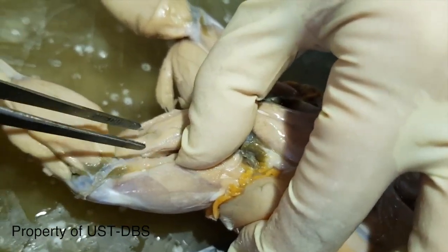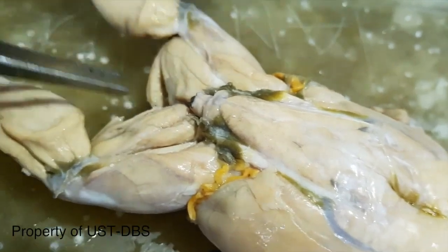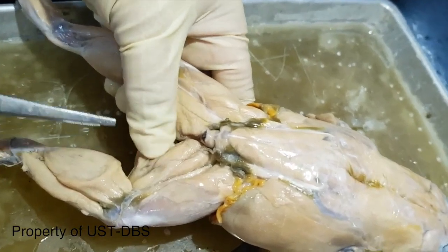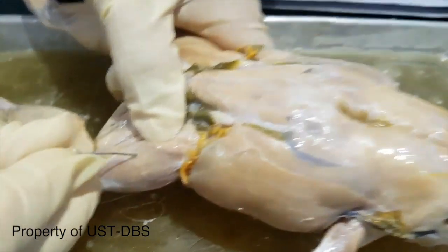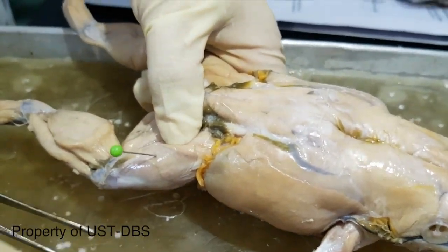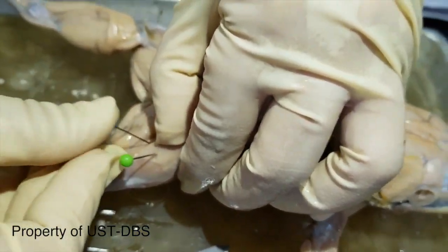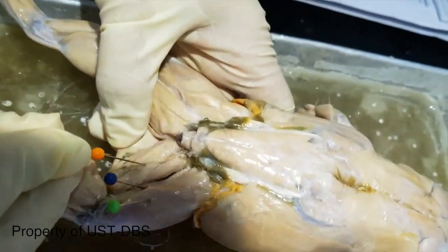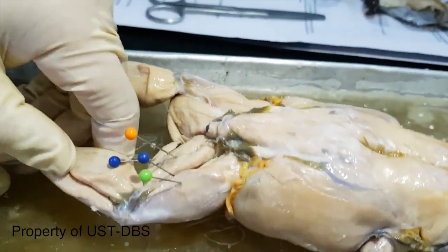This muscle here towards the inner thigh is the semimembranosus, and this flap of muscle is the gracilis minor, which can also be seen on the ventral side. Okay, so let's review: triceps femoris, biceps femoris, semimembranosus, and gracilis minor.